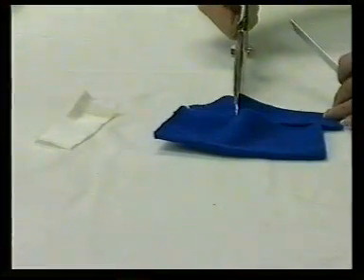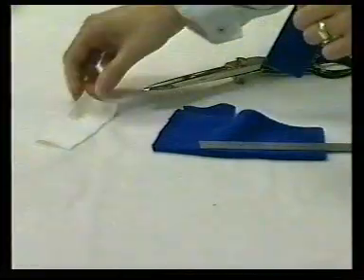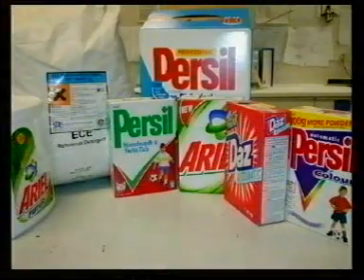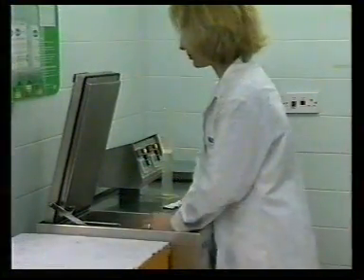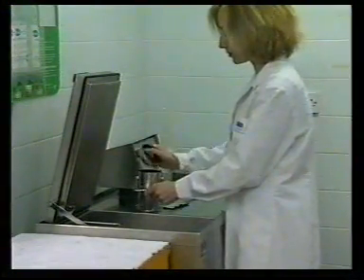We shall look at the effects of colourfastness to washing, where a sample of fabric is subjected to a prescribed washing process using a standard detergent solution in order to assess the ability of the dye to withstand the effects of a detergent during a specified time, temperature, and washing action.